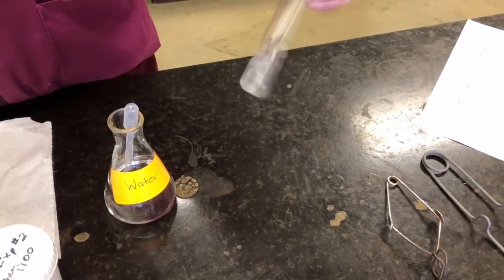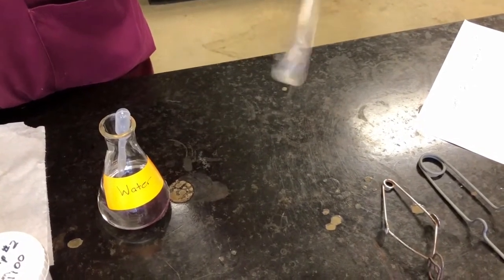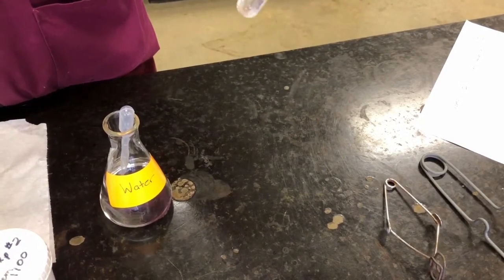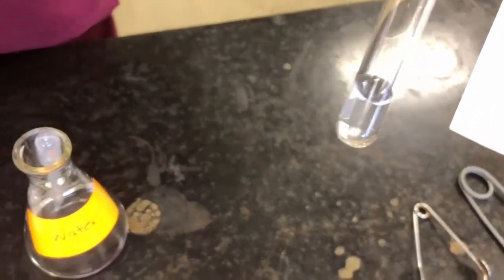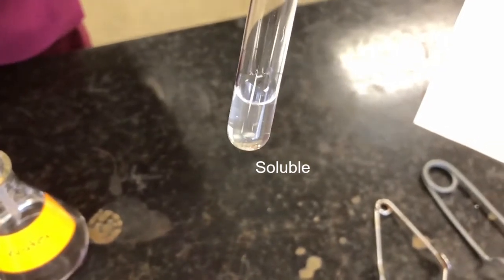And we can see that as I'm shaking it, it is pretty much all dissolving. There's a little bit down in the bottom. If I add a little bit more water, it should be able to dissolve all of it. But oh, there we go. It's all dissolved. So you can see that we don't see the salt anymore. It's all dissolved in the water, so that means that it is soluble.